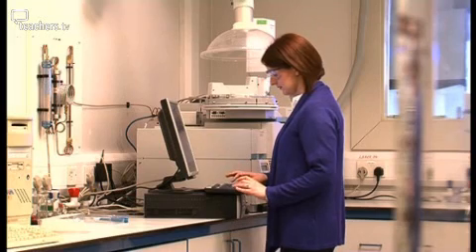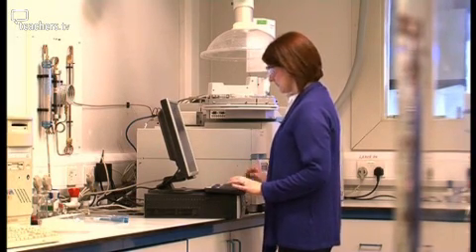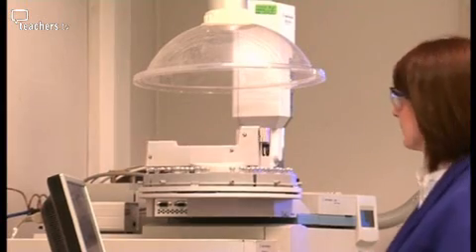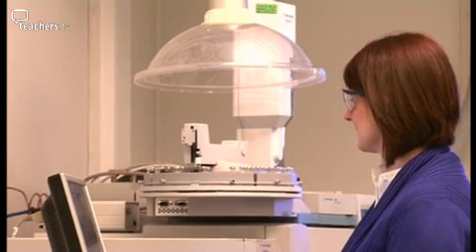Giving it a go meant firing up the GCMS to test the fly pupae casings. Gas chromatography mass spectrometry, or GCMS. It's combining gas chromatography with identification using the mass spectrometer. So the gas chromatography is a separation technique on its own. However, the identification comes from the mass spectrometer. So by combining the two together, you have a really useful instrument in forensics, in chemistry, in science in general.